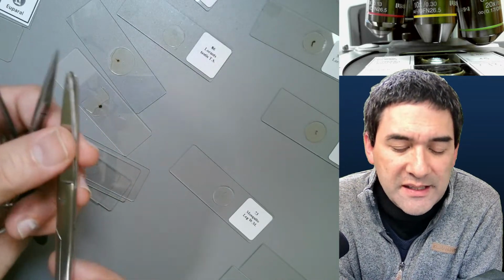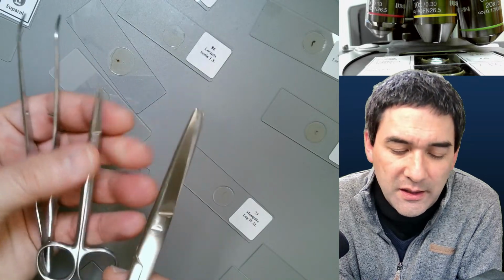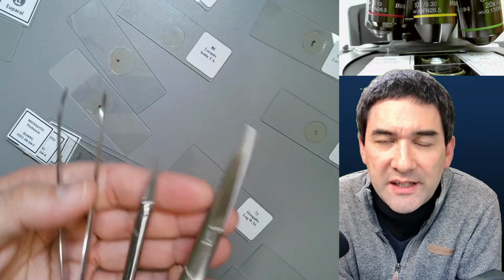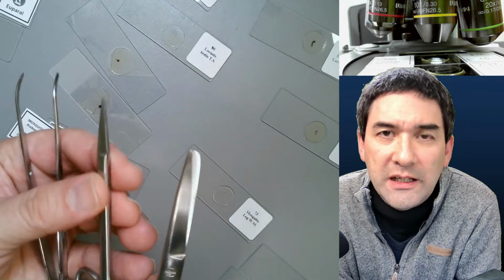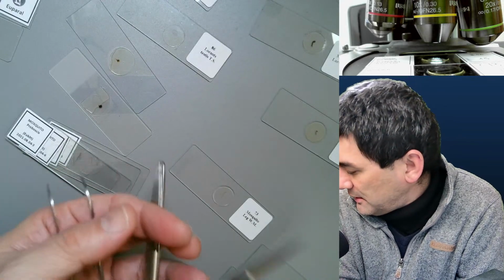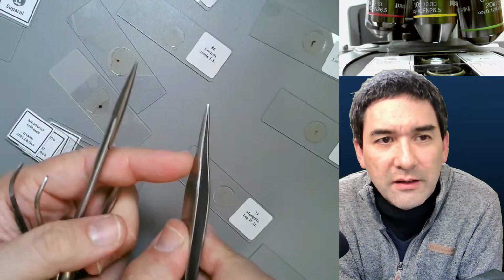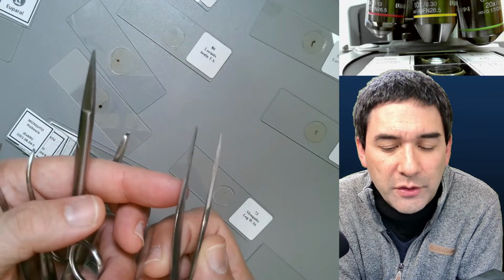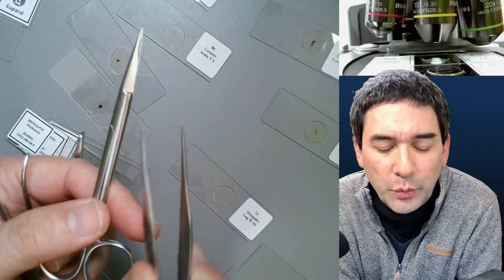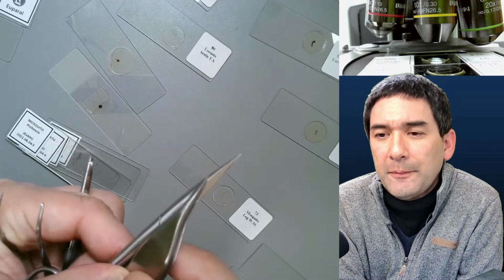These are basically dissection kits, and if you go on Amazon and Google dissection kits, then you find they don't cost a lot, but usually in those dissection kits you find more tools than you actually need. So I would say that a tweezer and scissors like this, and here it is, those fine tweezers are also very useful. Fine tweezers and those scissors, and you basically are covered for most of the things.